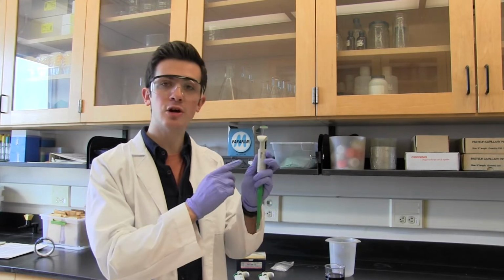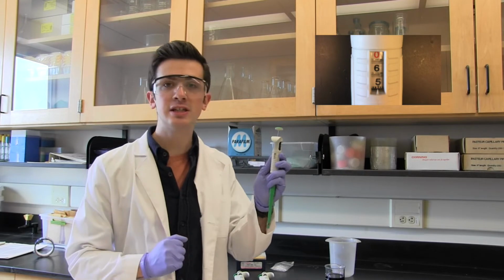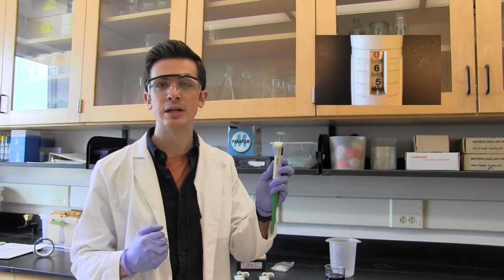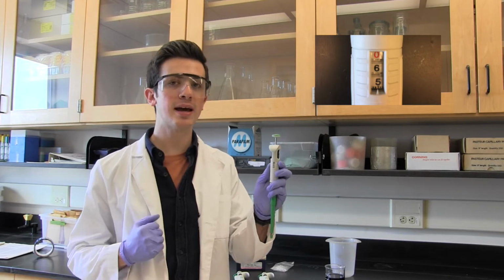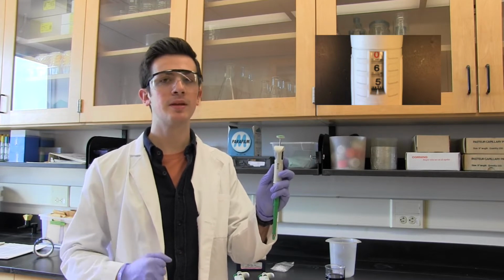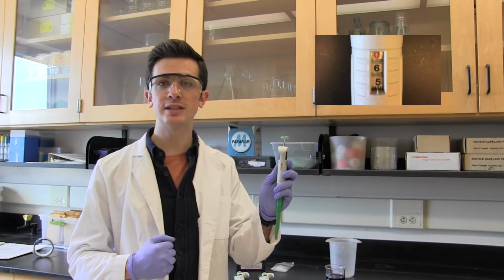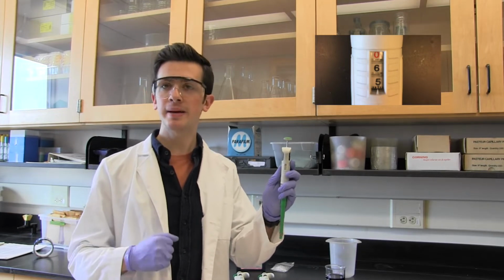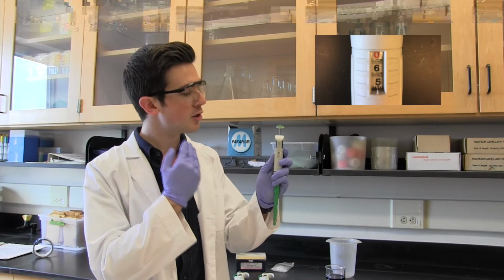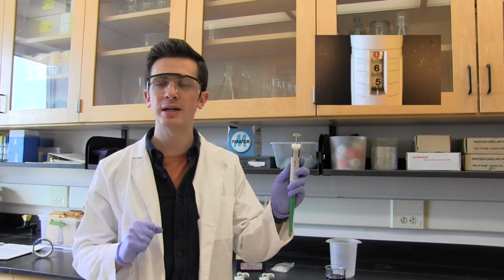make. These are denoted on the side of the pipette in the indicator. The first digit is usually whatever the highest digit is of the highest number. In this case, of the 100 to 1000 microliter pipette, that means it's the thousands place. Below it is the next highest place, the hundreds place. Below that is the third digit, the tens. Most pipettes only have 3 digits. However, below that, there's an array of hash marks, which could be used to make more refined measurements.